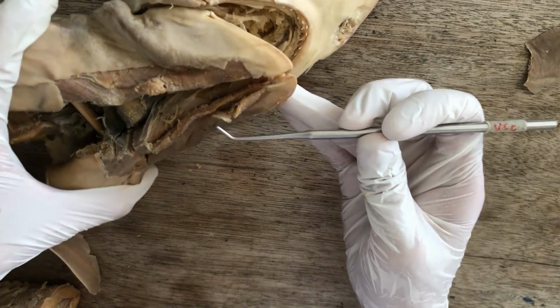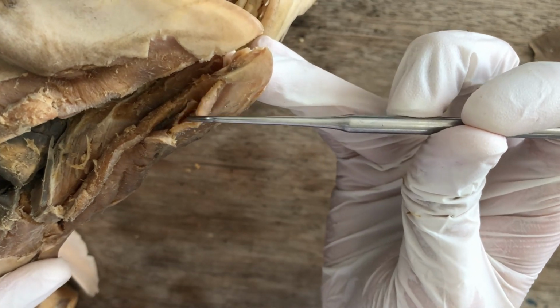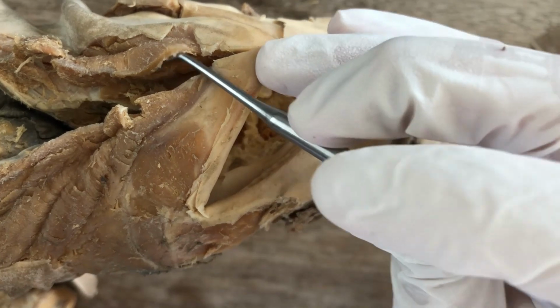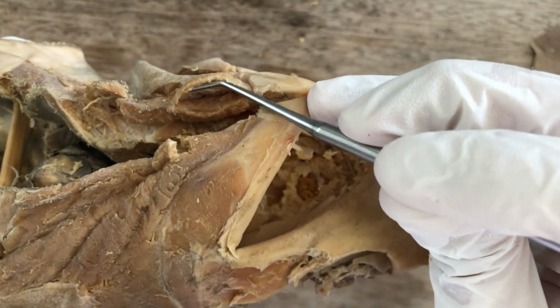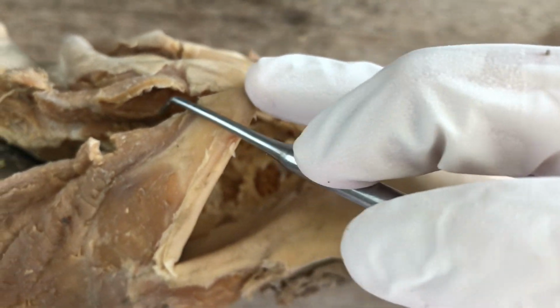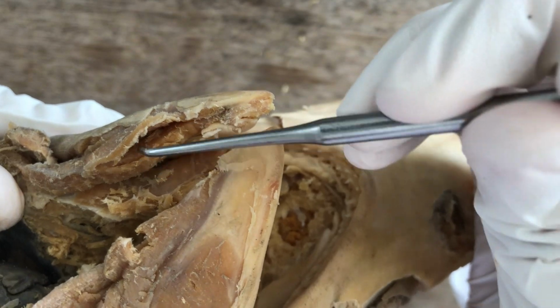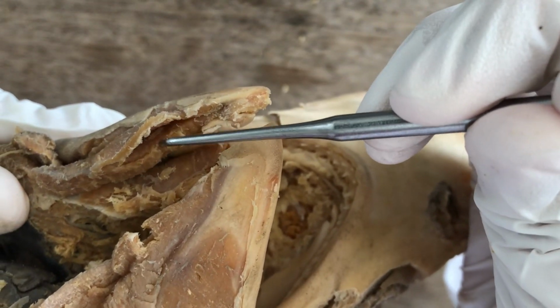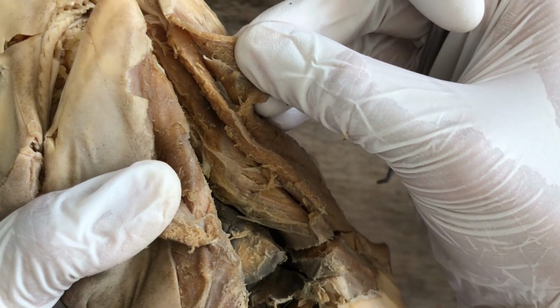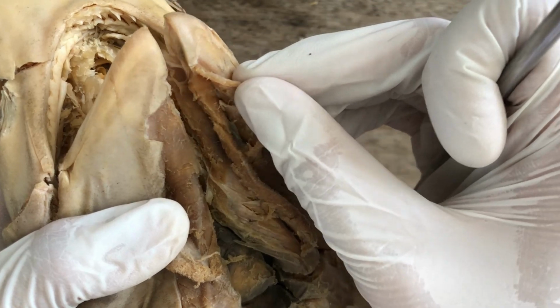The superficial most muscle that's reflected here is the intermandibularis, the ventral constrictor 1, intermandibularis again, and there's another layer there, the interhyoideus. From the other side, that's the interhyoideus. I'm touching or reflecting the intermandibularis.